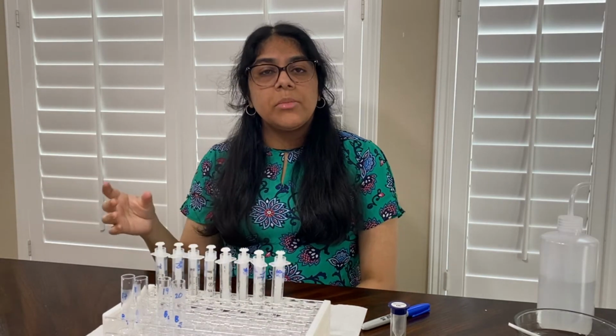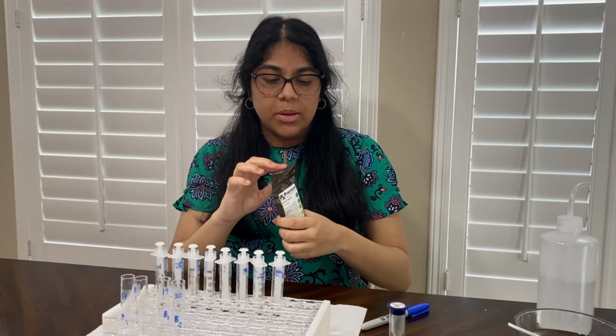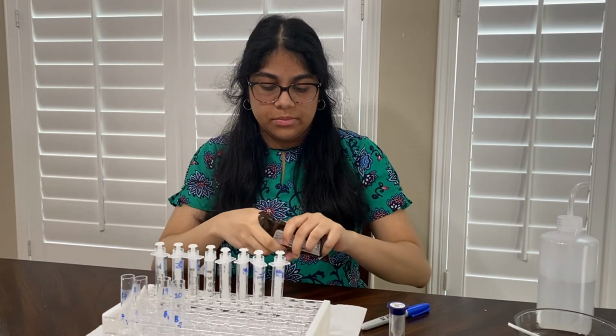Okay, so now I've completed all 4 pool tests, and I'm going to have one test strip, and I'm going to test each pool.